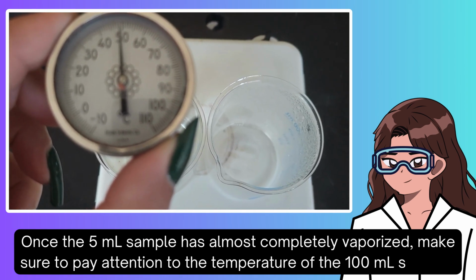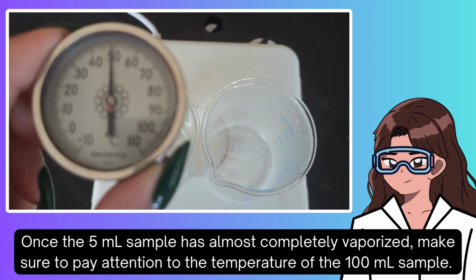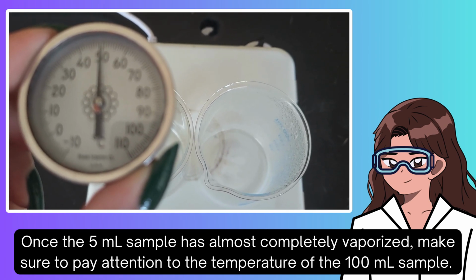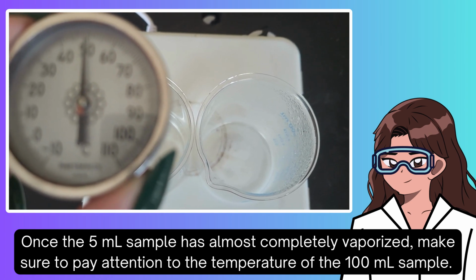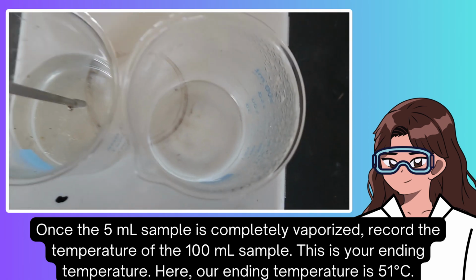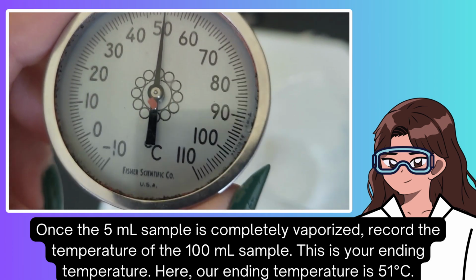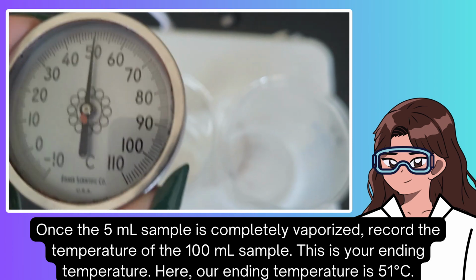Once the 5 milliliter sample has almost completely vaporized, make sure to pay attention to the temperature of the 100 milliliter sample. Once the 5 milliliter sample is completely vaporized, record the temperature of the 100 milliliter sample. This is your ending temperature. Here, our ending temperature is 51 degrees Celsius.